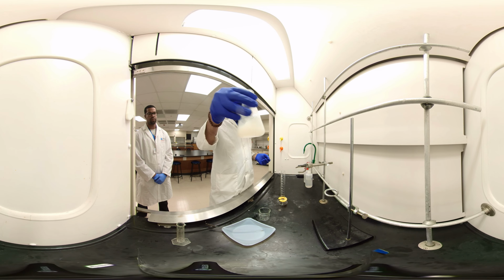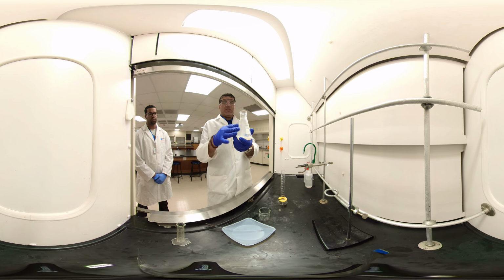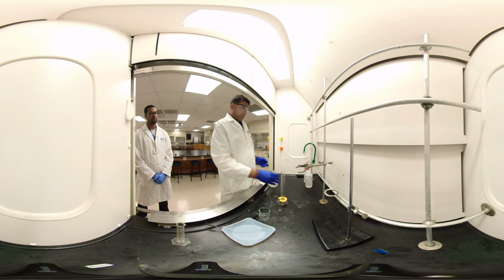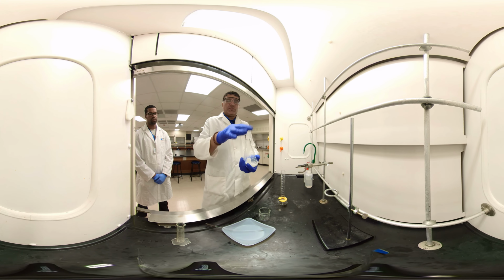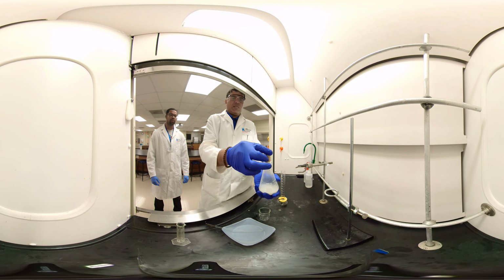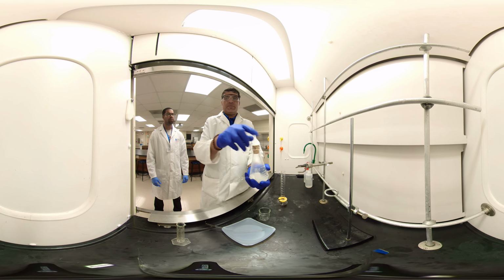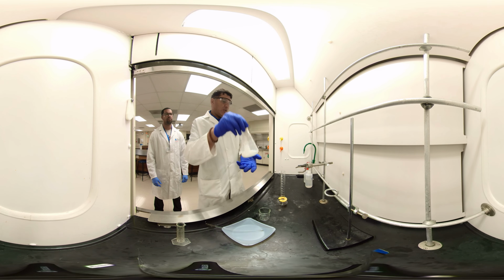We mix it. Okay, we have to start the experiment early. We cannot complete it the same day because the reaction takes time to complete. It's really hot. I'll leave it like that. And when it cools down, I'll put the cork on. I'll wait maybe 10 minutes, then I'll put this cork here and leave it there for 1 week. Then we perform from there. We separate the benzoic acid and benzyl alcohol from the product. We continue from there.